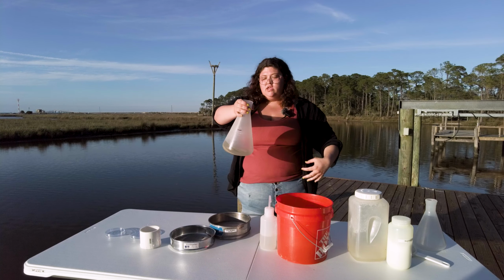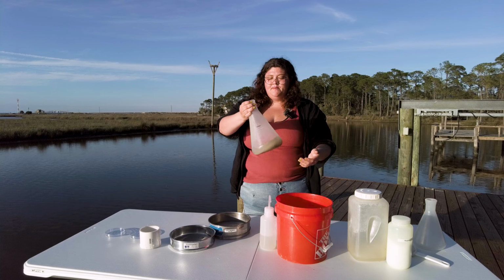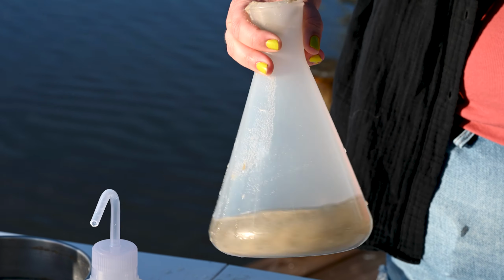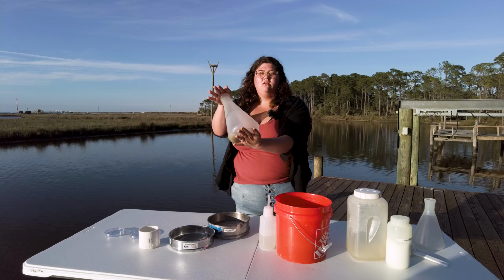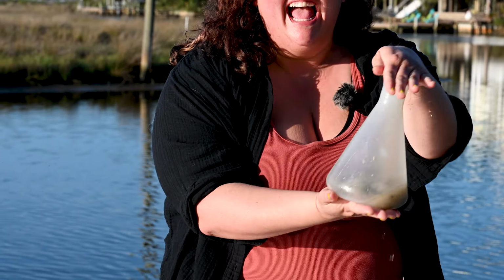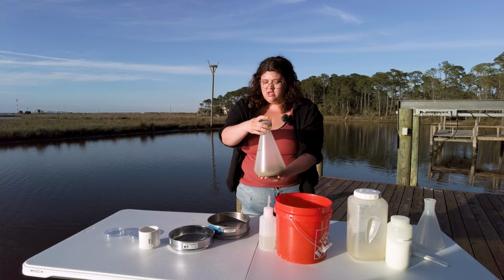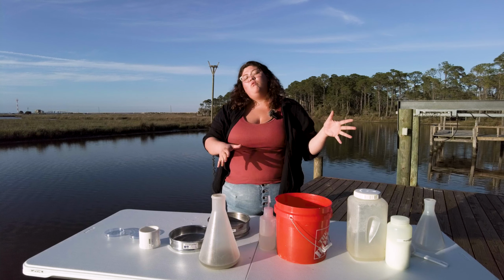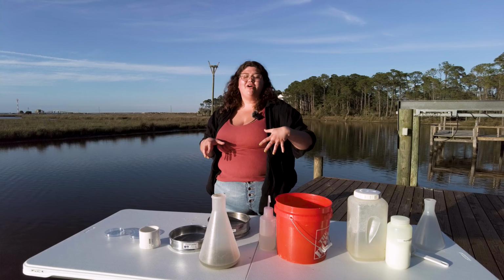Now we want to make sure that the magnesium chloride gets through all the sediment, so we wanna stir it up. You kind of wanna do this gently. These animals are extremely tiny and can be quite fragile. One method that we use is this kind of figure 8. That just mixes up the sediment with that magnesium chloride and it will relax those animals. Then you just let it sit for about 15 minutes. We let it settle and then we'll come back and run it through the sieve and get our sediment into Petri dishes so we can look at the animals that we find.